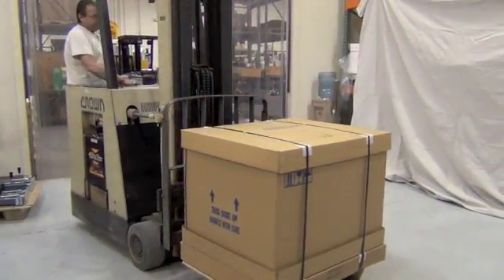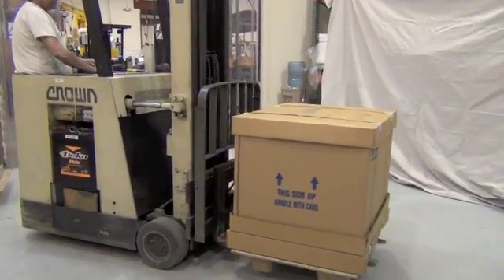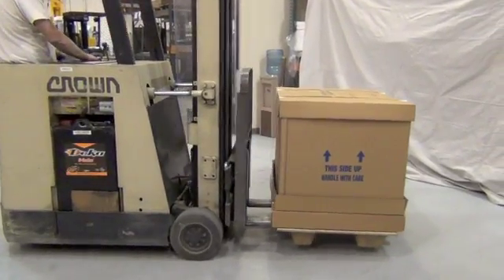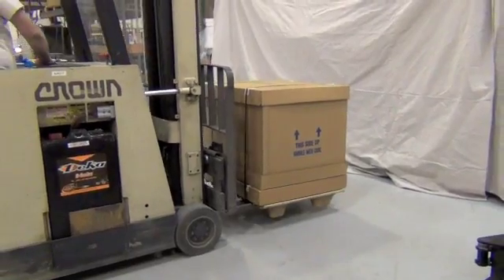Remember to practice safe lifting and handling. When in doubt, seek assistance. TMC is always available by phone to help with questions.